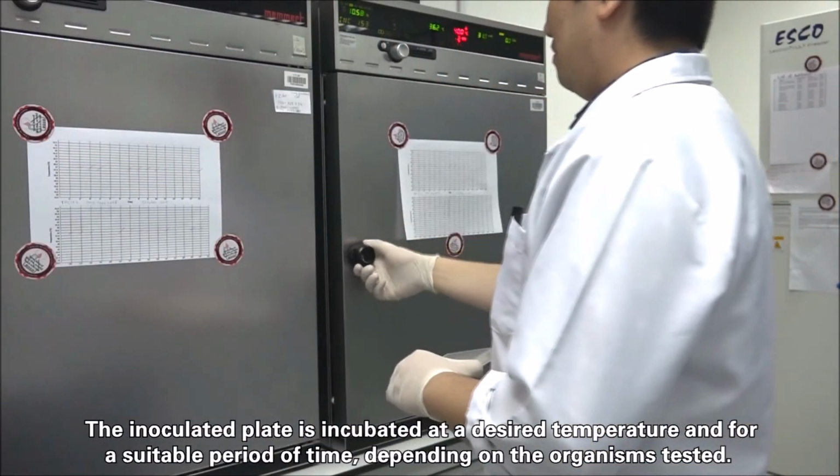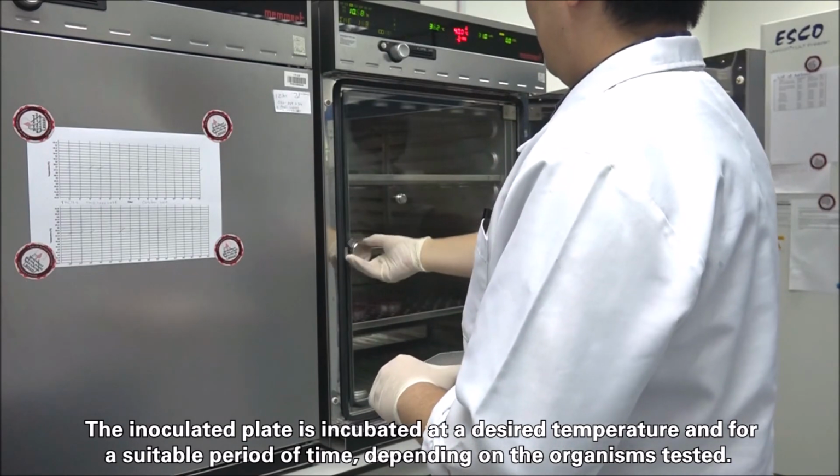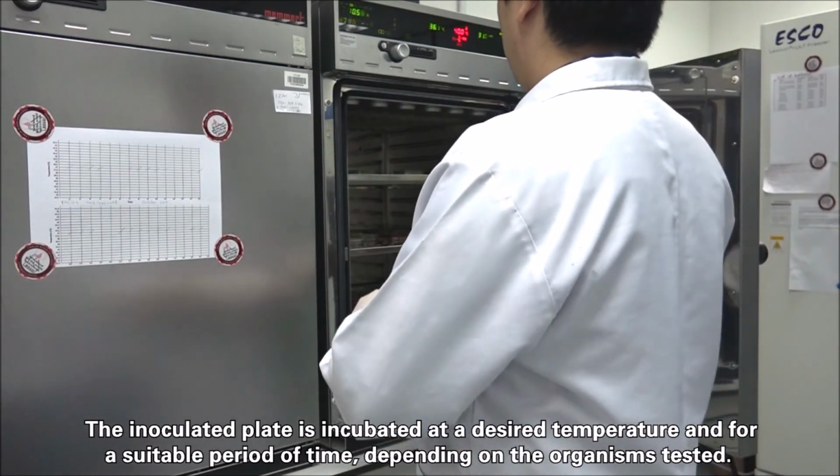The inoculated plate is incubated at a desired temperature and for a suitable period of time, depending on the organism tested.